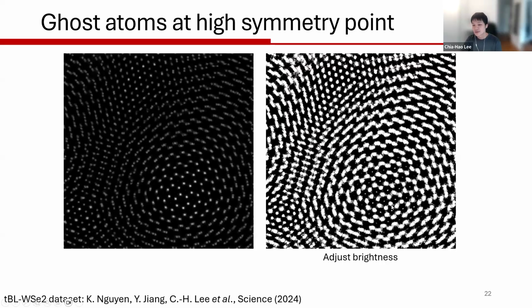But at this moment, I'm suspecting that's because this data set itself is a focused probe data set, and we have a fairly large scan step size, so things are not constrained as well. Just something to keep in mind that sometimes you may see some faint contrast at high symmetry points. You probably want to ask yourself again whether this is an actual atom or just an artifact coming from the ptychography reconstruction, because translation symmetry in your scan pattern can sometimes give you some weird results in the ptychography reconstruction.